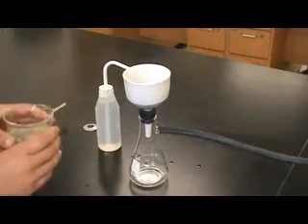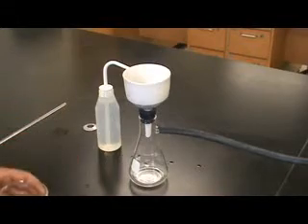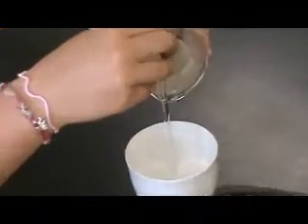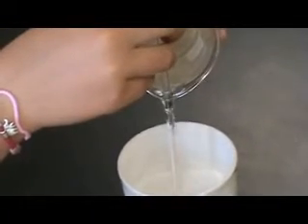Once you have a working setup, clean the apparatus and repeat the procedure using your solution and precipitate. Here we are using DI water and sand to show the process of vacuum filtration.